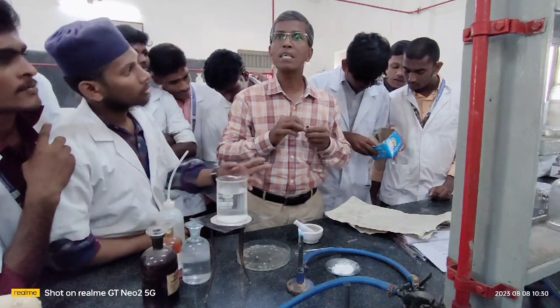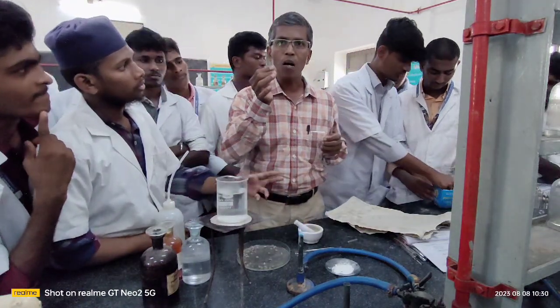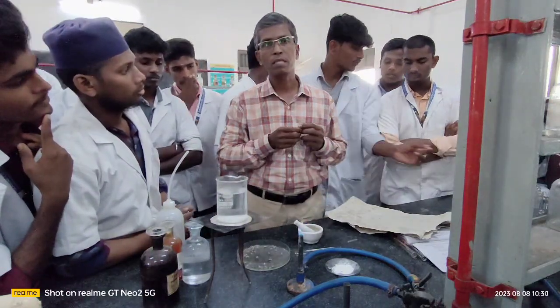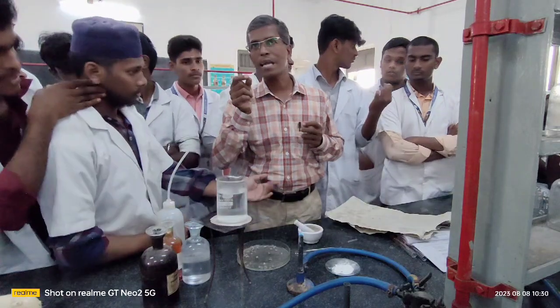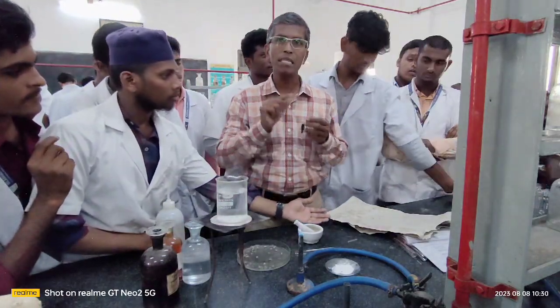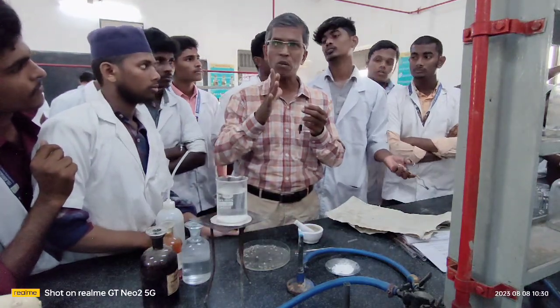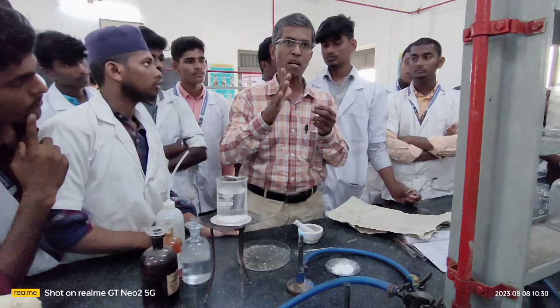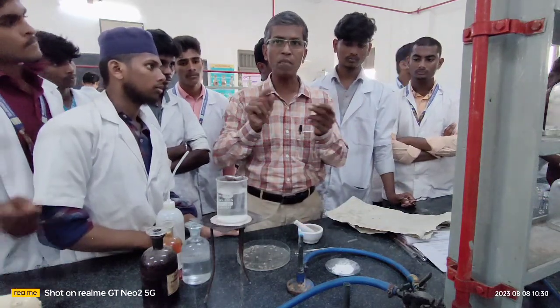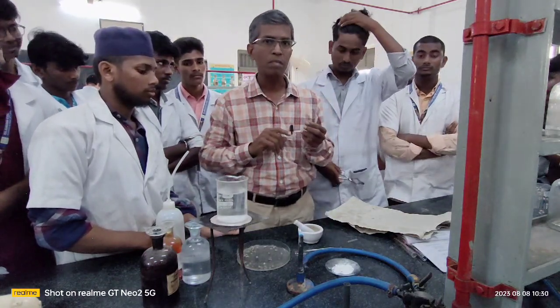Please listen to me. Now I am going to demonstrate how to prepare the sodium fusion extract. This is again an important step in your organic compound analysis. Without doing this, you can't proceed further. You can't carry out the confirmation of nitrogen and other elements in general without the help of this sodium fusion extract.